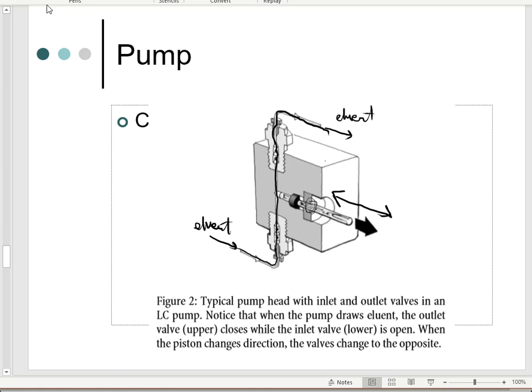Okay, so this gives you an idea of how that pump is working from a side view, showing you the back end that gets to my instrument, and this is the front end on this side that you're not seeing, but this is the side that you would see if you open up the cover and look at it front face like we did in that video. So this gives you a better idea of the structure of the inside of that pump and how it works and how it takes care of the mobile phase from that point. So let's go back and take a look at some of those other videos. There were a couple of others that focused on the pump, so let's see what else we can do that concerns the pump as part of the preventative maintenance and making sure it's going to work the right way for us.